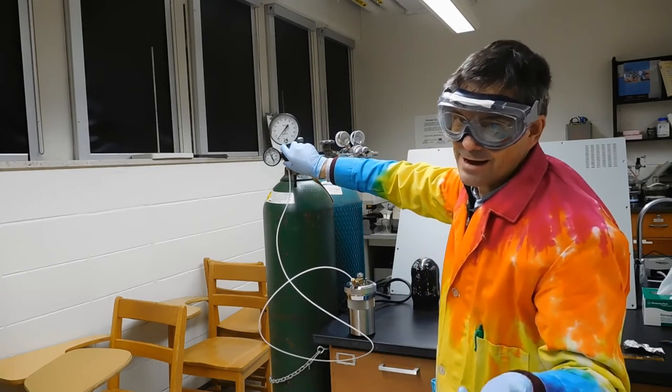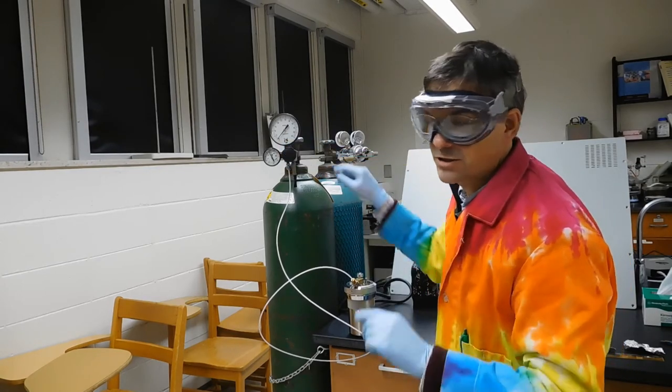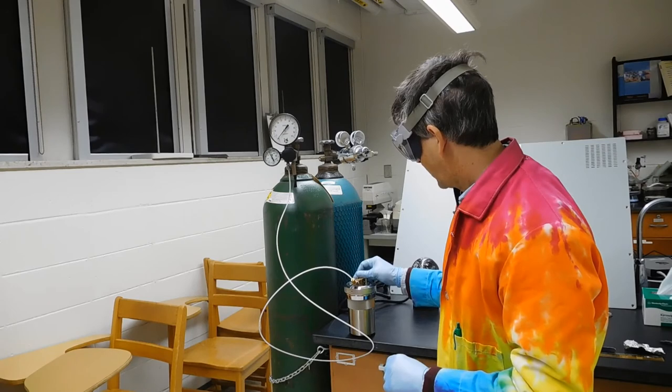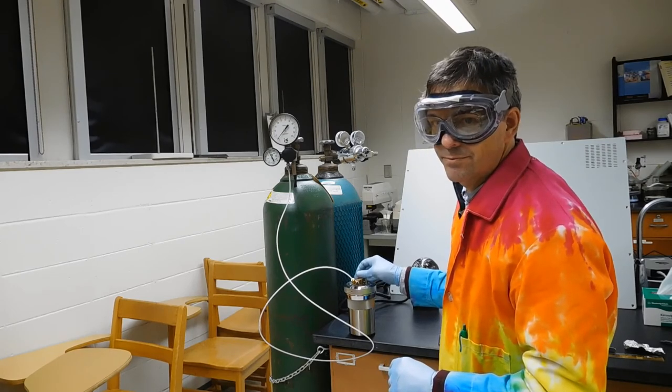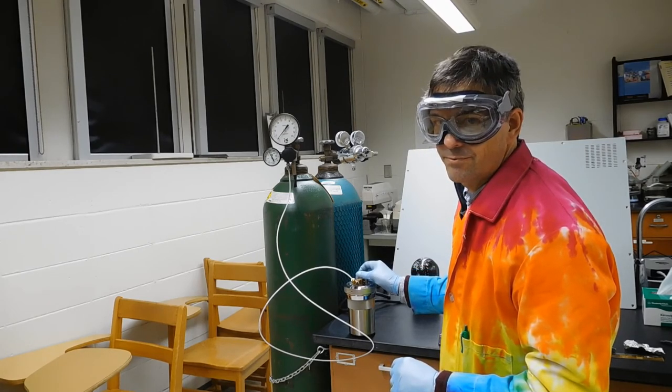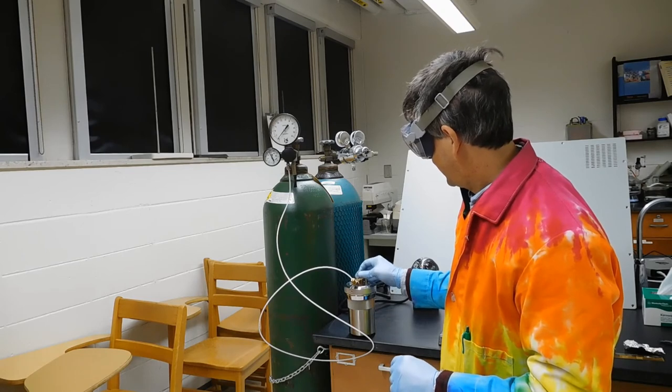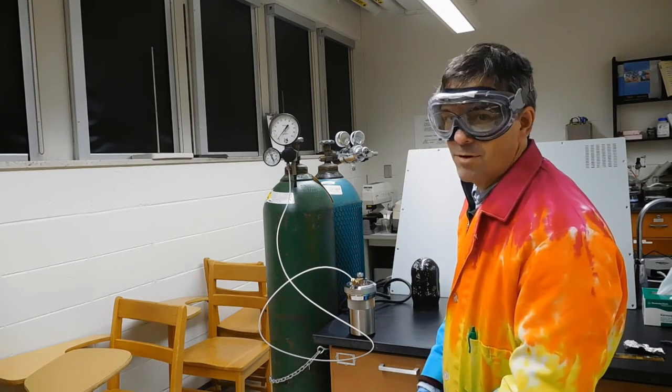Now, you're not done, because the protocol is to do this twice. So then you just open this up and release the pressure.